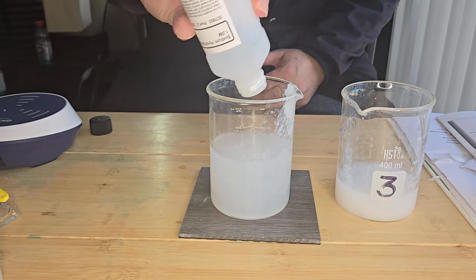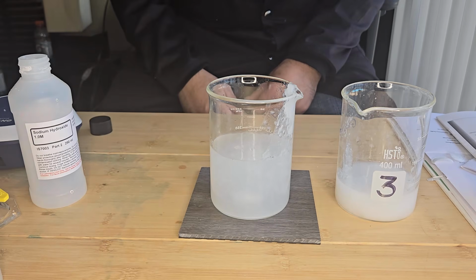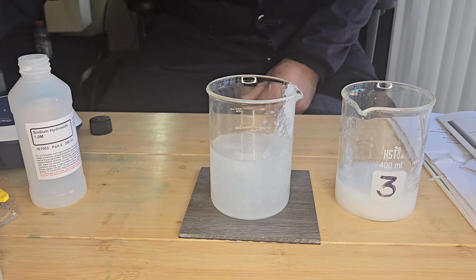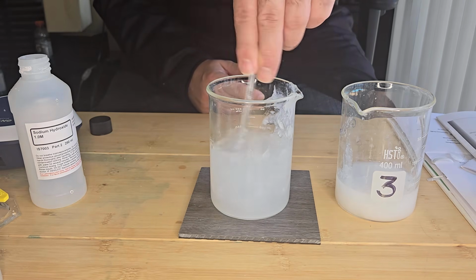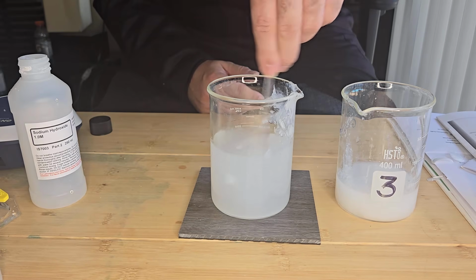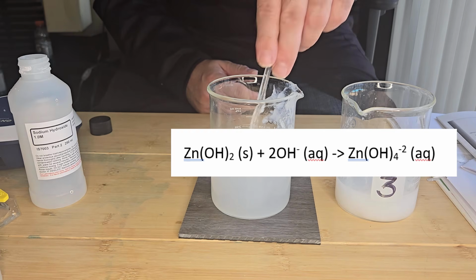And what happens, the precipitate settles out, it crashes out and dissolves, and this precipitate dissolves to form a zincate complex.